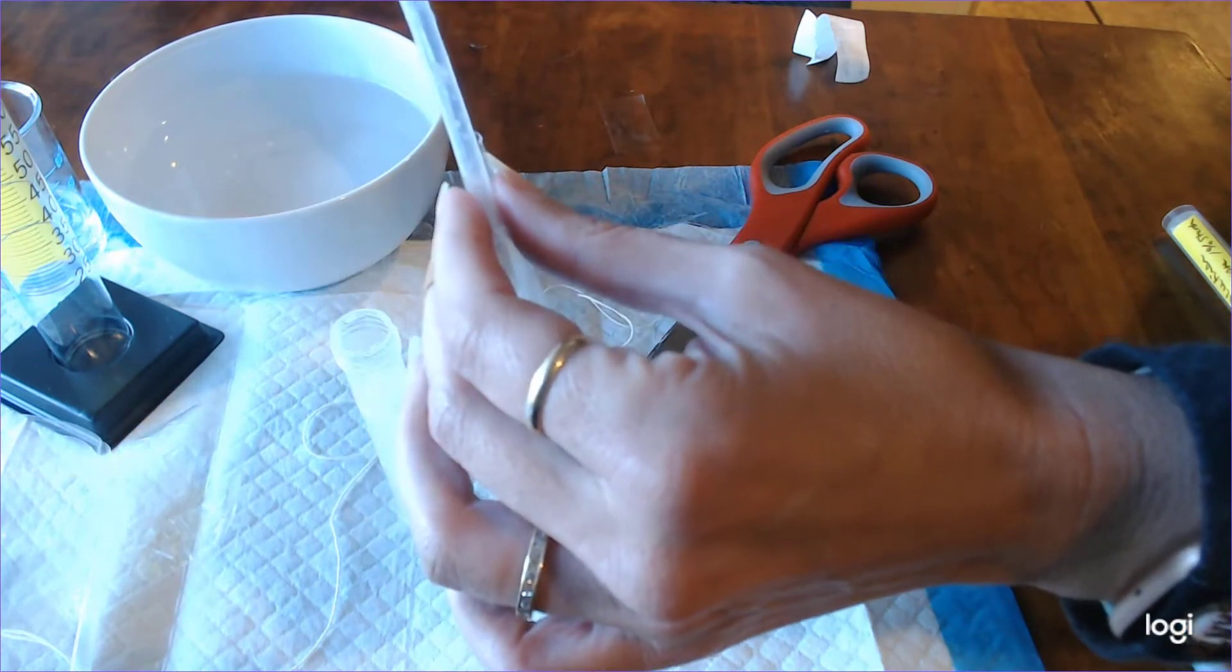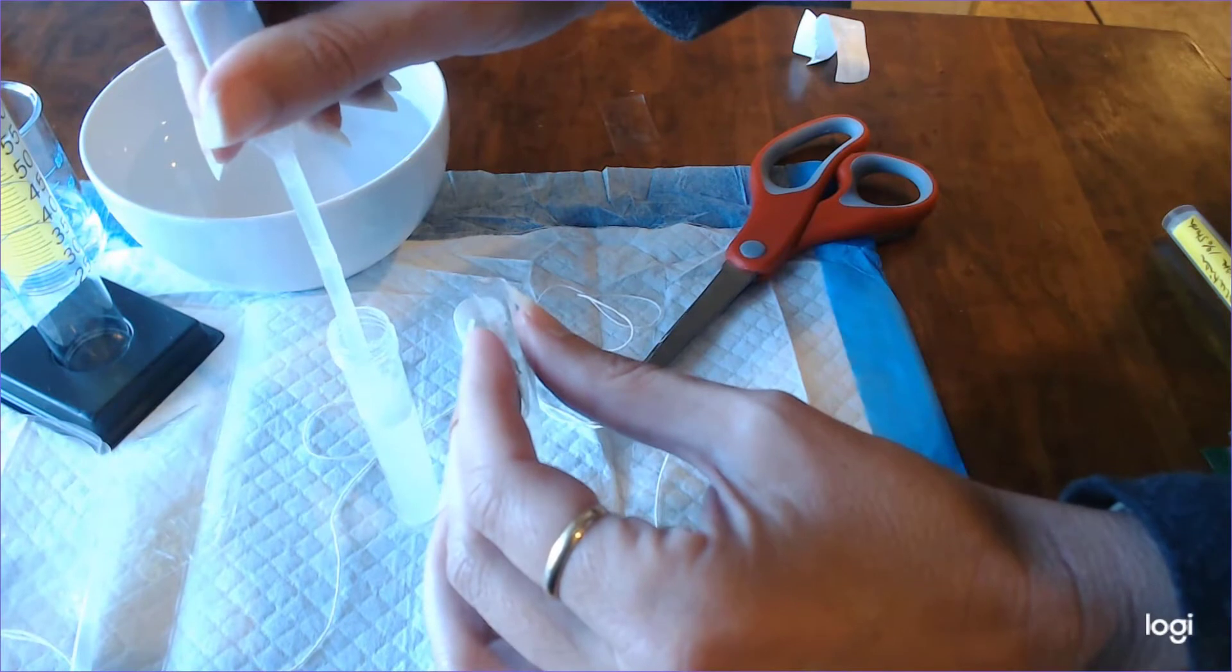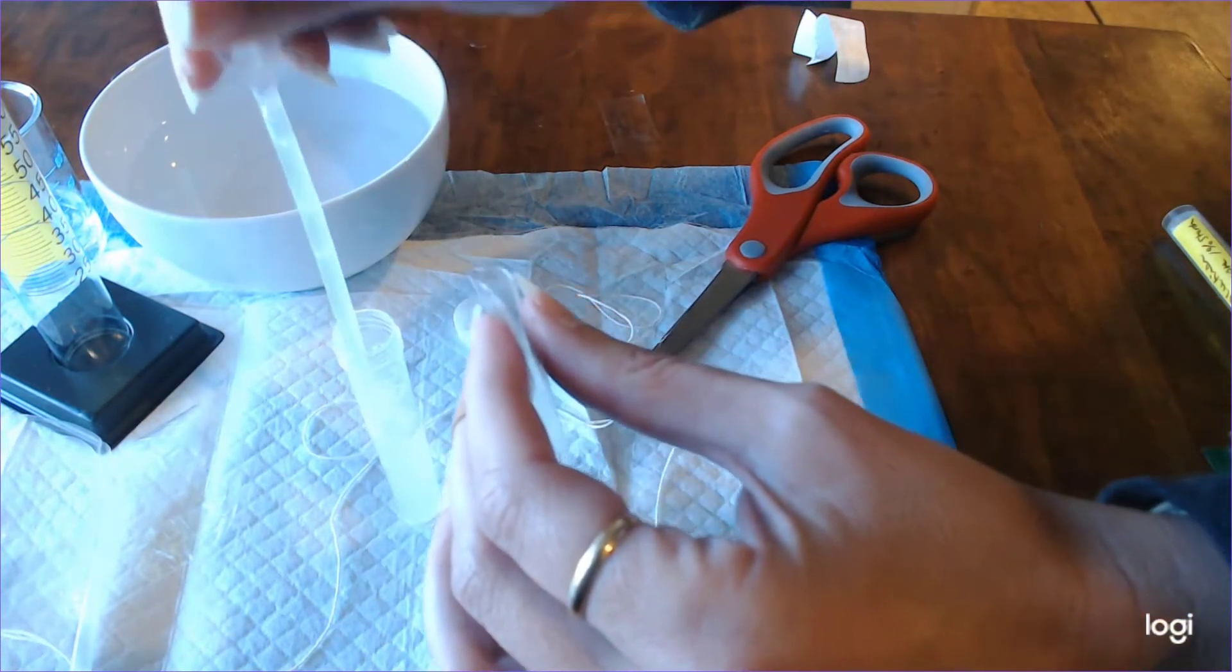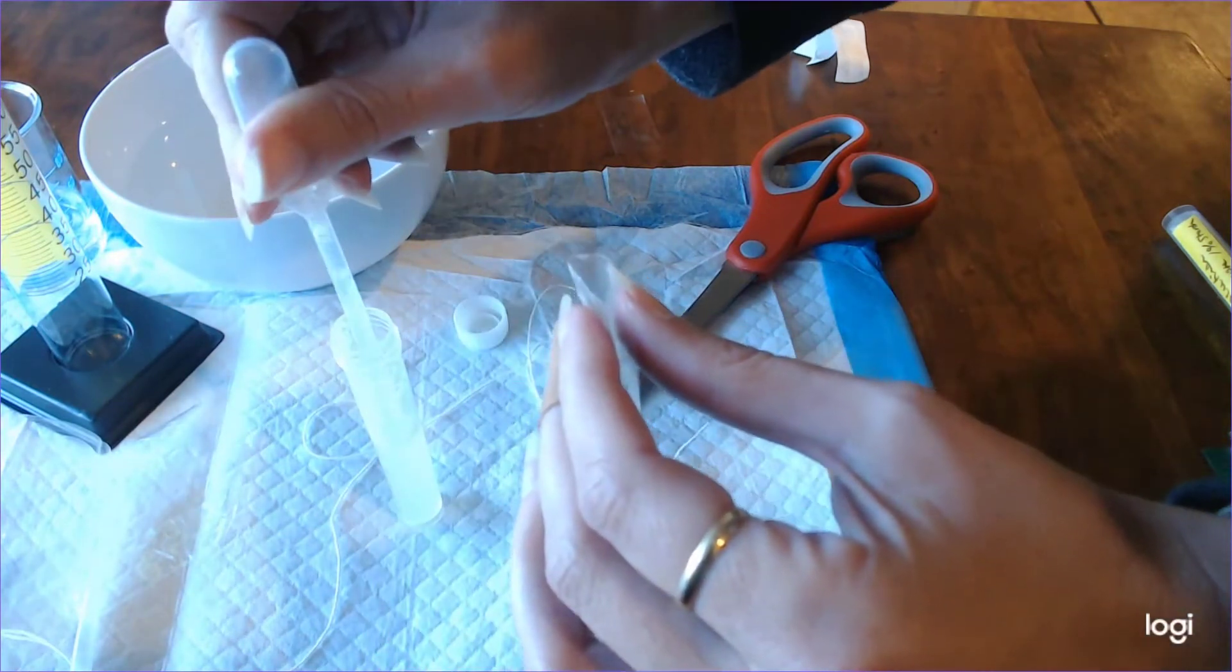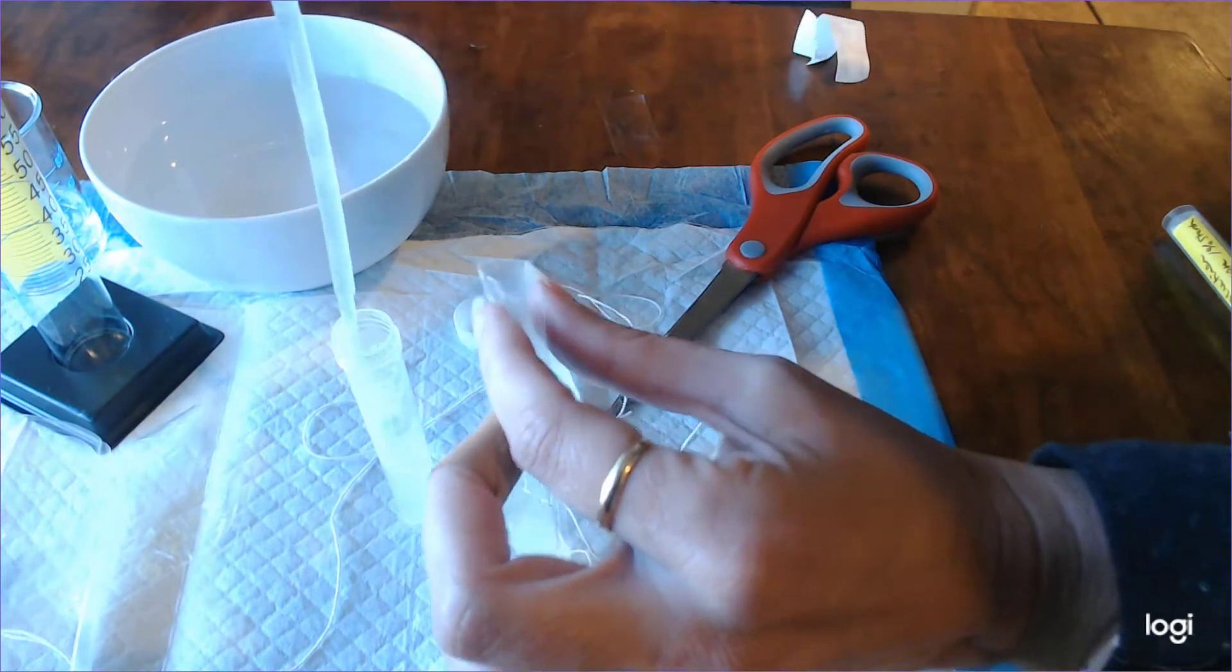So then go ahead and take your pipette and go ahead and transfer the solution over. It'll take you a little bit but it's a nice clean way to transfer that solution into the dialysis tubing.